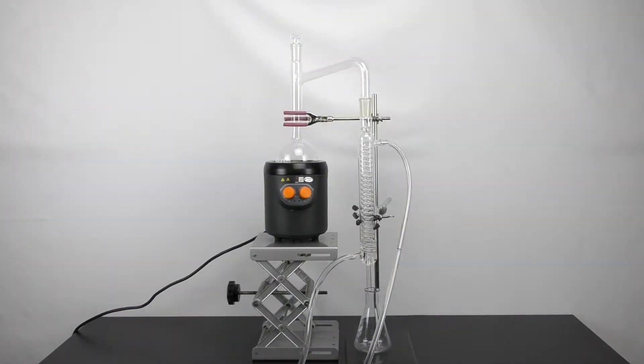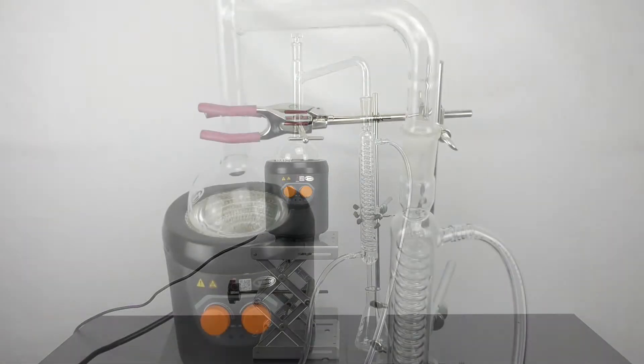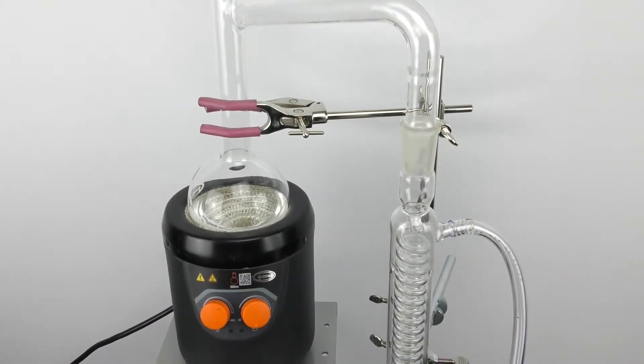Here is the complete setup and I just put in a mixture of isopropyl alcohol and water just to do a simple distillation experiment. I'm just starting to see the beginnings of some bubbling.